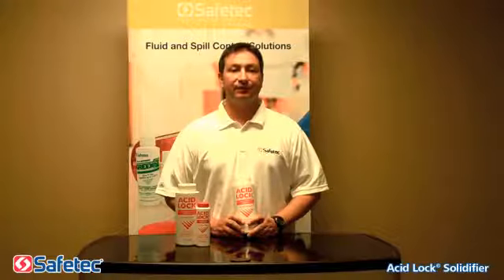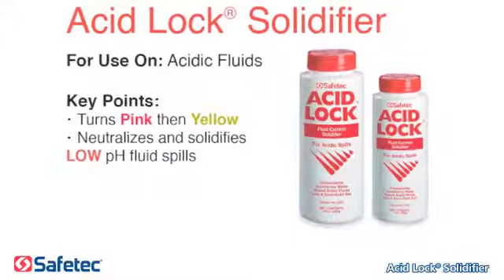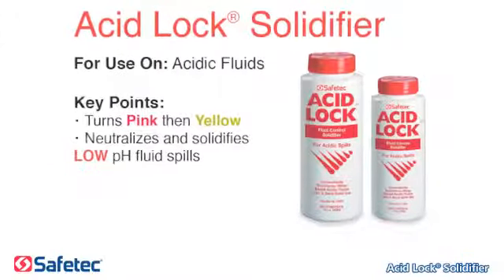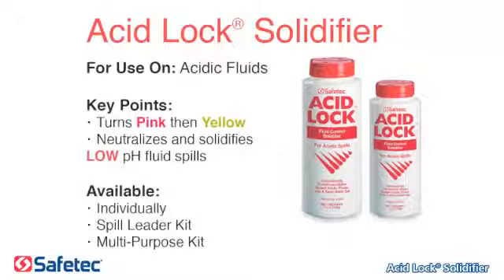Today we'll be demonstrating the chemical spill control solution, Acid Lock. Safetec's Acid Lock Solidifier is for use on acidic fluids. Key points to remember: when the low pH solution turns pink then yellow, it is safely neutralized and solidified. Acid Lock is available individually in the Spill Leader Kit and the multi-purpose kit.